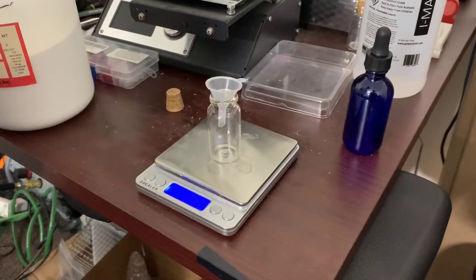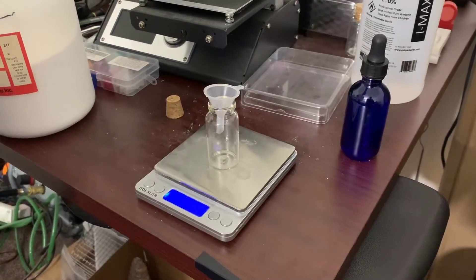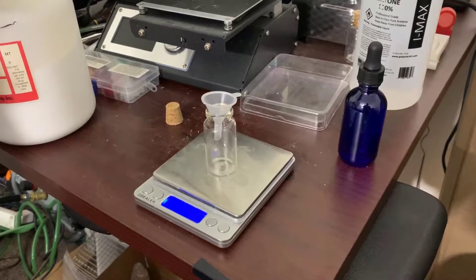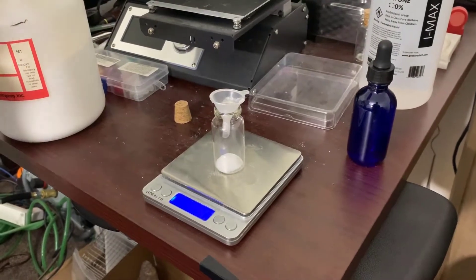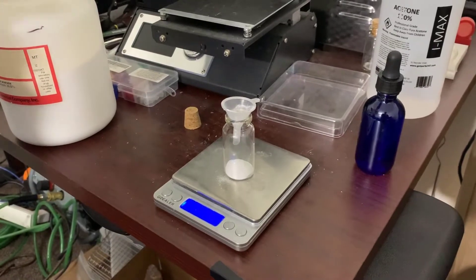The first step is to get a scale and a bottle with a funnel of some sort. You're going to place the bottle on the scale and tare it. That will allow us to actually weigh the amount of cellulose acetate in grams. We're going to start by inserting cellulose acetate through a spoon of some sort.